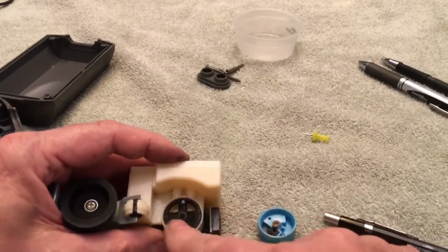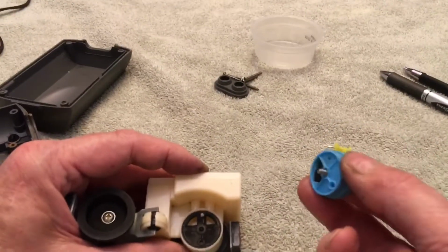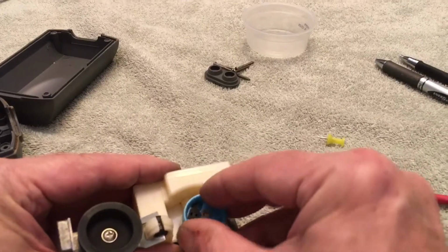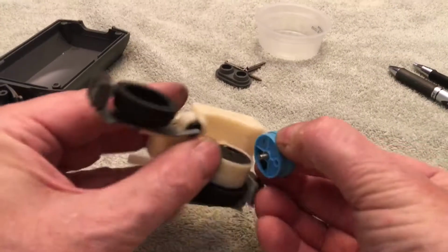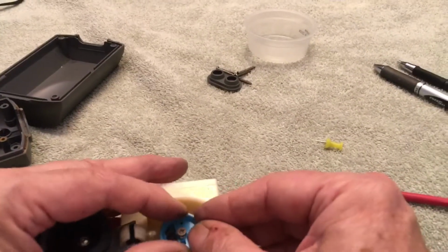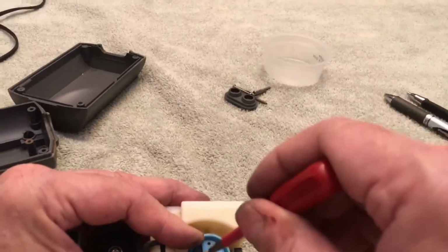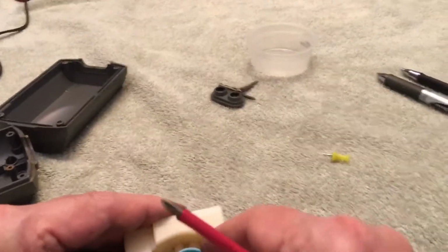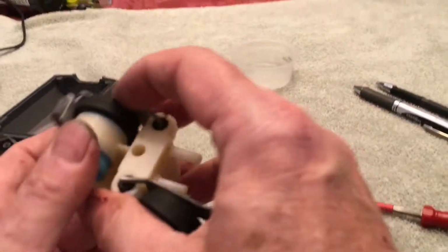Same deal. Once again, we got lucky because of the hole that lines up. And we're going to try and make sure that it's turned all the way, since that hole isn't quite as precise as the pin slot. Once again, making sure everything's not overtightened but good and secure. Check your seals.